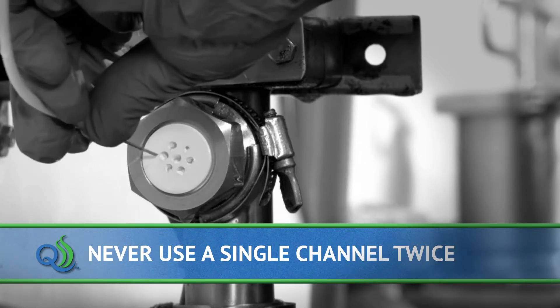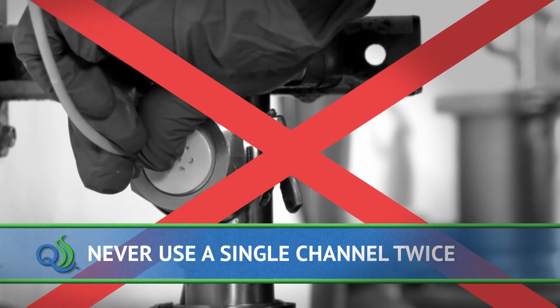To avoid contamination, never use a single channel on the septum twice.